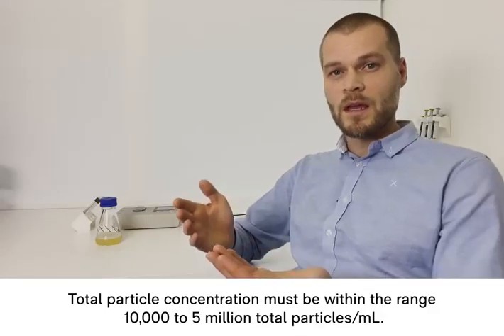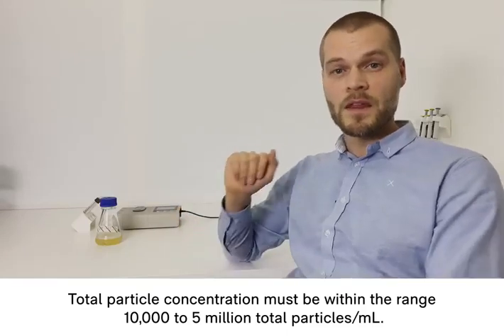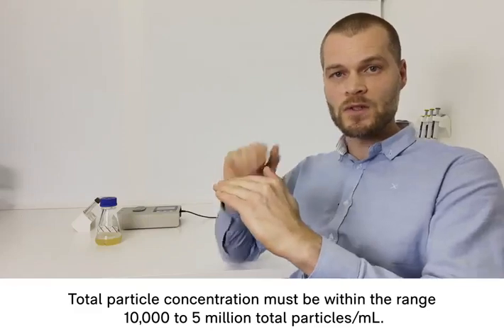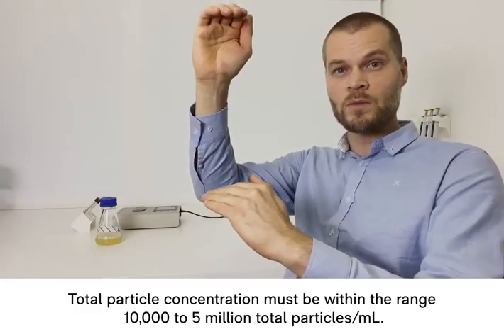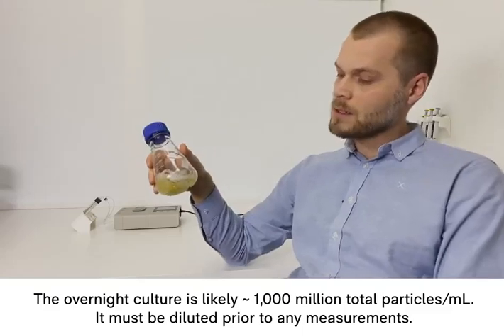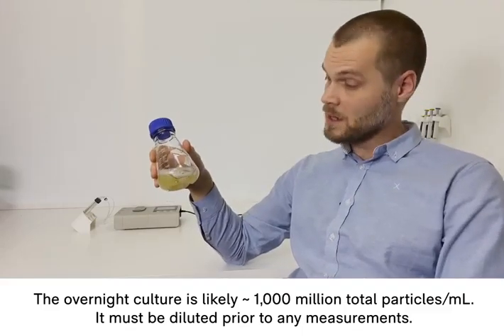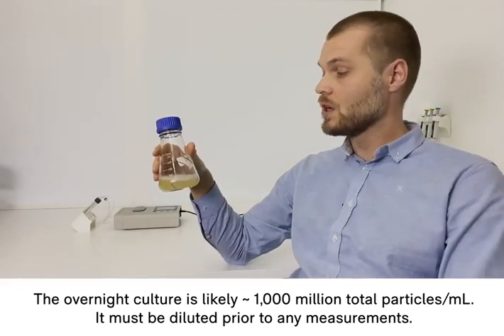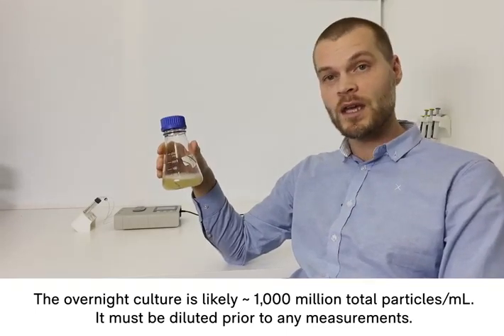Apart from conductivity, it's also very important that the particle concentration is within the measurement range from 10,000 to 5 million total particles per milliliter. This overnight culture is probably something like 1,000 million per milliliter, which is way too concentrated for the BactoBox, so it must be diluted prior to any measurements.